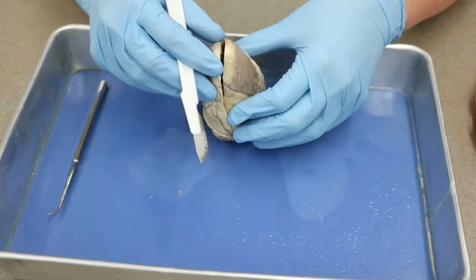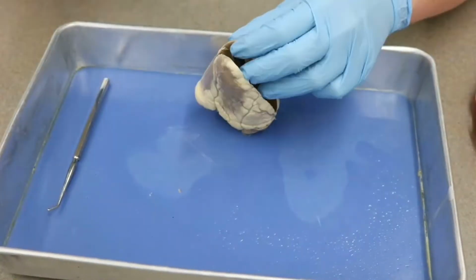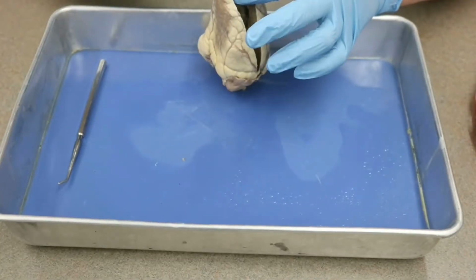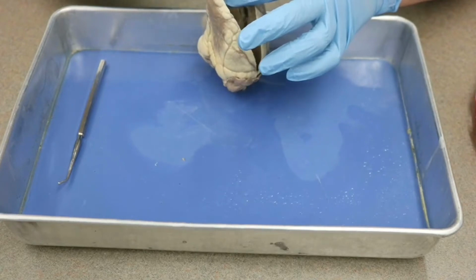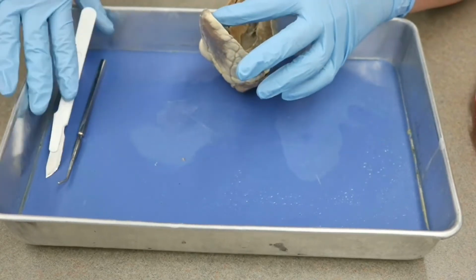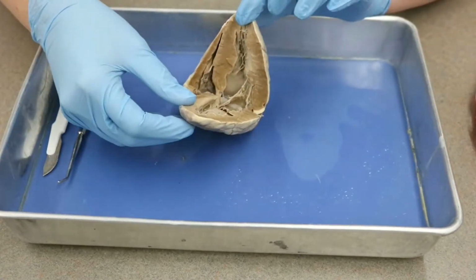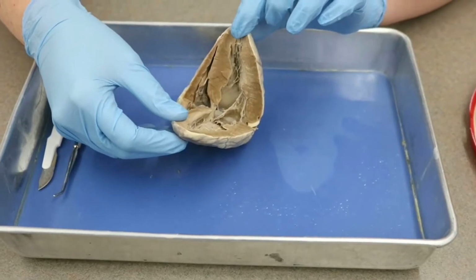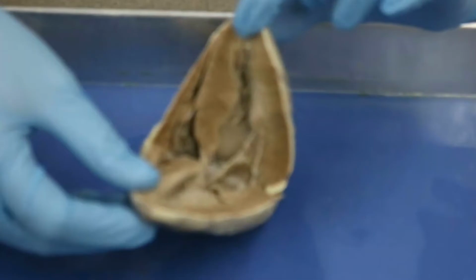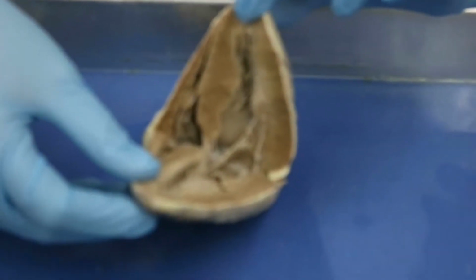So what we need to do now, very carefully, pulling it open, and I can't show you and do this carefully myself, so I'm going to have to look down myself here and just cut down any tissue that is holding it back. Okay, so I'm going to go ahead and open it up here, and you can see how this looks. Okay, so we've just cut through. This is, of course, a coronal or frontal cut of the sheep heart.